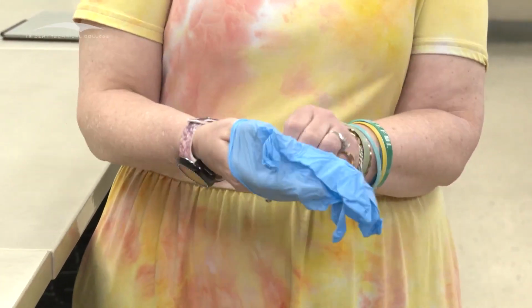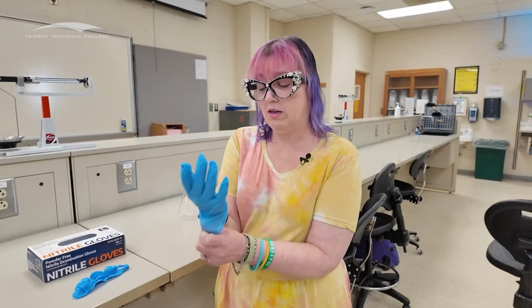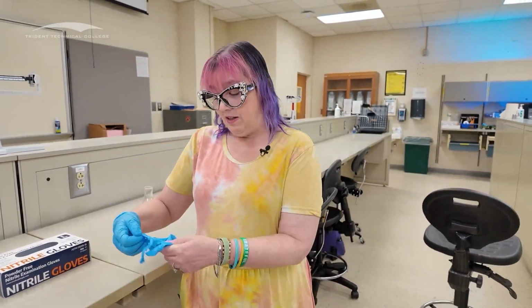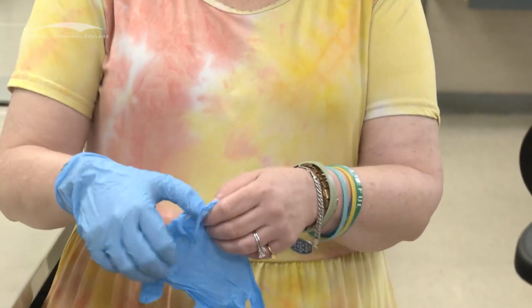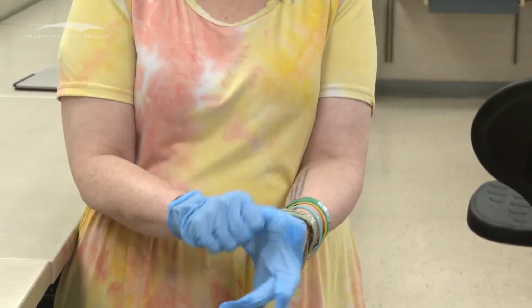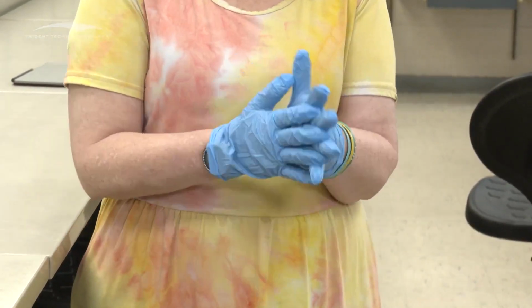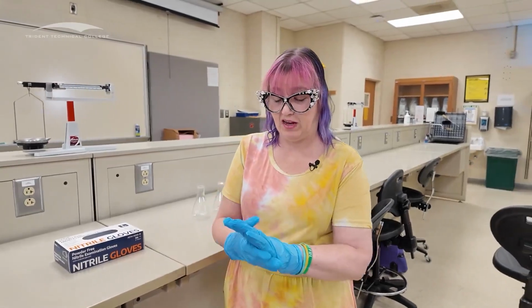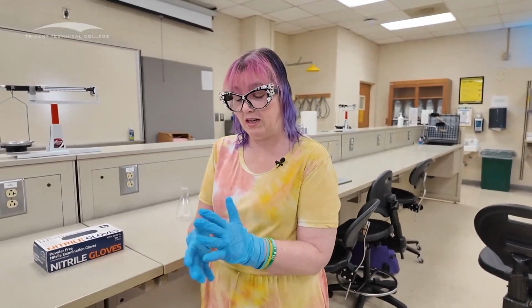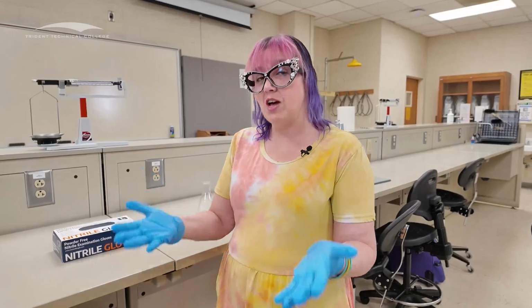We want to make sure that we get our thumbs into the thumb spots on our gloves. So that's one. I want to get that over my watch because I want to make sure I don't kill my watch while I'm wearing it. And then have my second one, if I can get this thing sorted out because they're all shoved in there, not necessarily easy to put on. Some people take their rings off before they do this. It depends on how big your rings are. I have ones that are tiny so I don't break through my gloves. That was a decision we made. But these are how I put them on. Putting them on is the easy part. Okay? Taking them off is not the easy part.